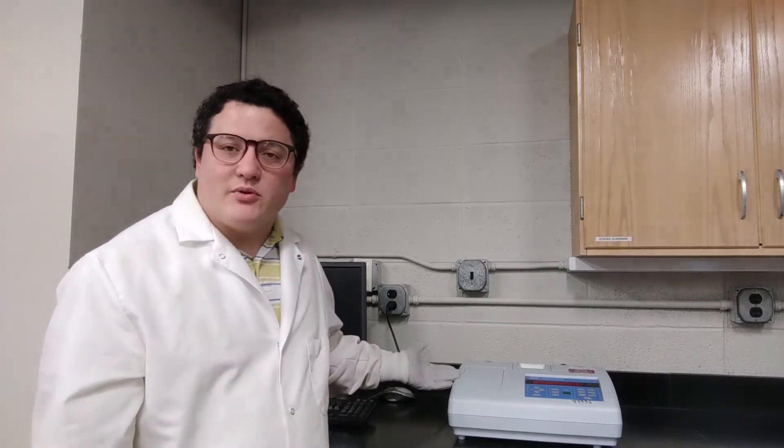Now turbidity is an analysis that we don't do all that often, but it's a fairly easy one. It uses this pretty simple instrument right here, and so it's a good place to start in the inorganics laboratory.